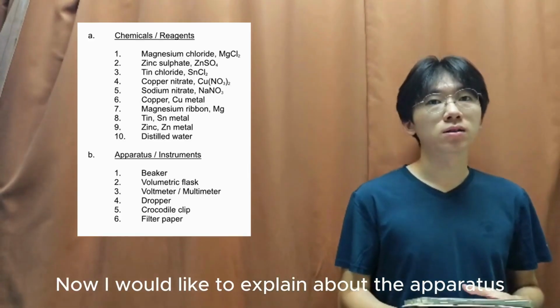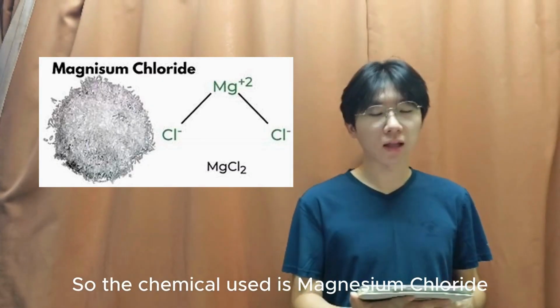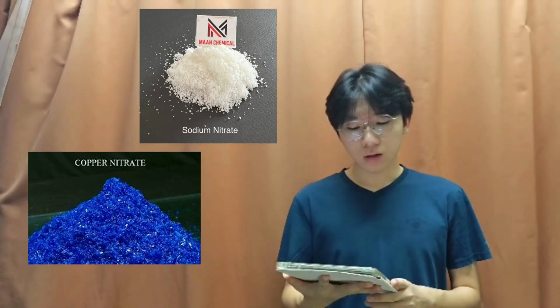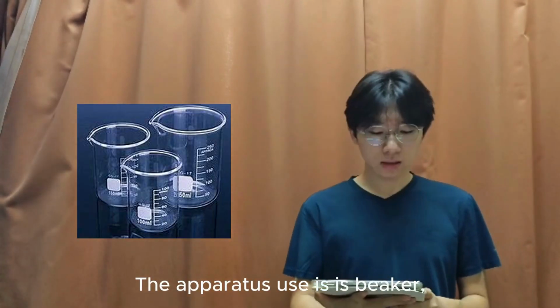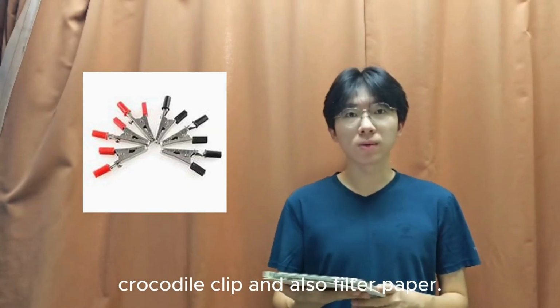Now I'm going to explain about the apparatus and also the chemicals used in experiment 2. So the chemicals used are magnesium chloride, zinc sulfate, tin chloride, copper nitrate, sodium nitrate, copper metal, magnesium ribbon, tin metal, zinc metal, and distilled water. The apparatus used is beaker, volumetric flask, voltmeter, dropper, crocodile clip, and also filter paper.